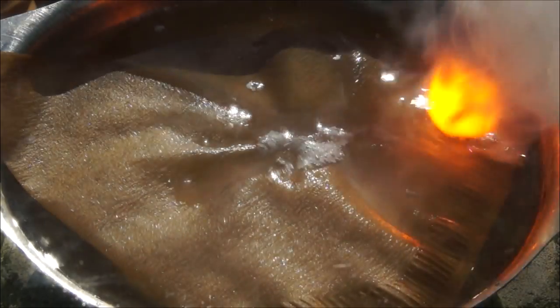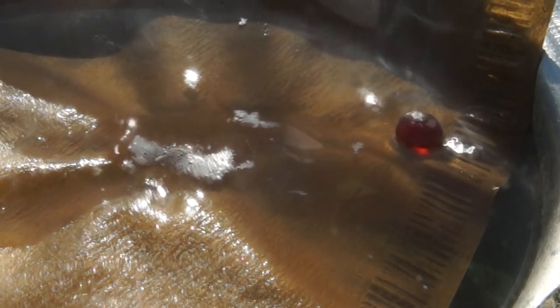If we assume that we are dealing with sodium hydroxide, then why does this droplet not sink and instead float on the surface of water? The density of sodium hydroxide is two times greater than the density of water. Or we can assume that we are dealing with undiscovered properties of sodium metal — the ability to acquire a transparent state under certain conditions.